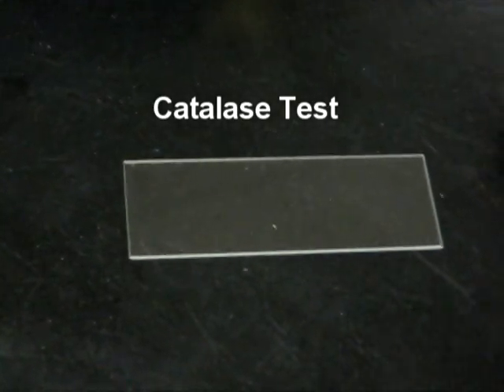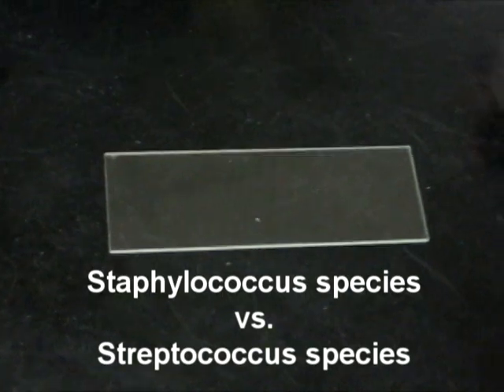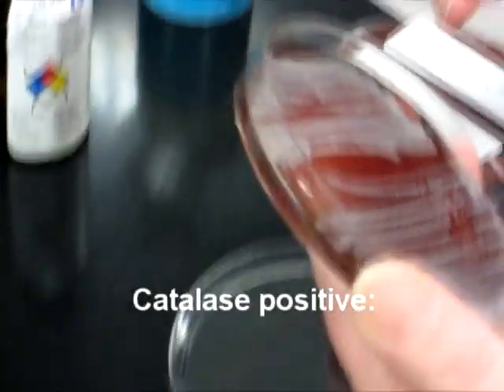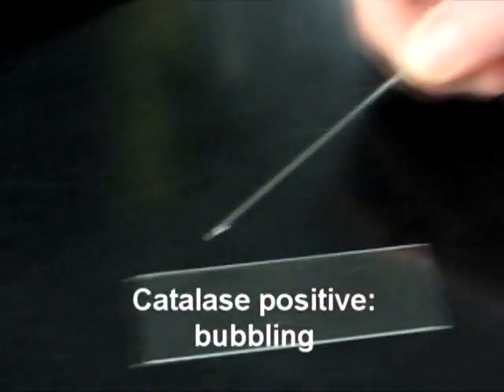The catalase test differentiates between Staphylococcus species and Streptococcus species. You use 3% hydrogen peroxide, placing a drop on the slide. You touch the center of your colonies, and if the organism is catalase positive, you'll get immediate effervescence bubbling.